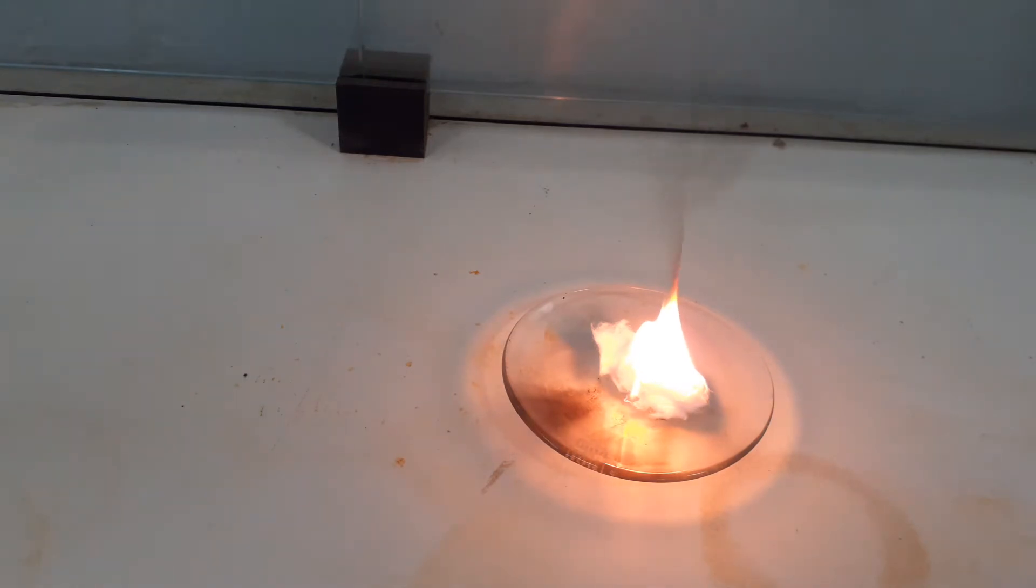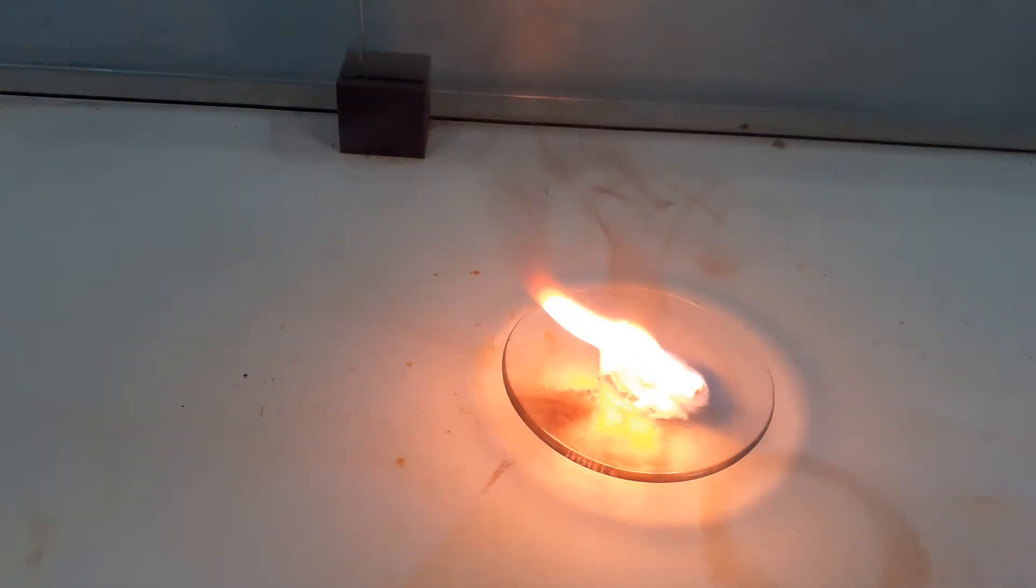It's harder to light because the molecules are larger so its ignition temperature is greater. As you can see there's a much more smokier flame because the percentage of carbon is higher. It's not the greatest of fuels.